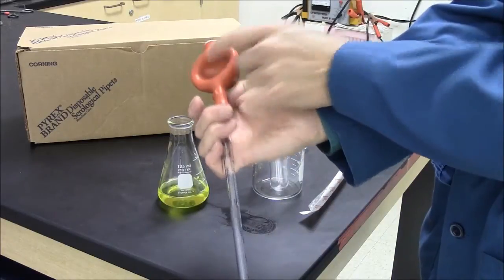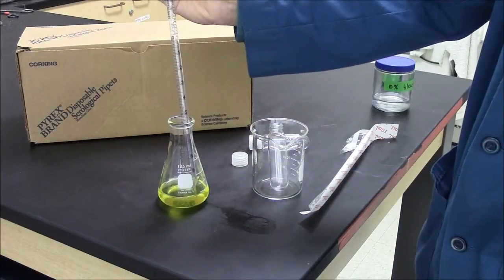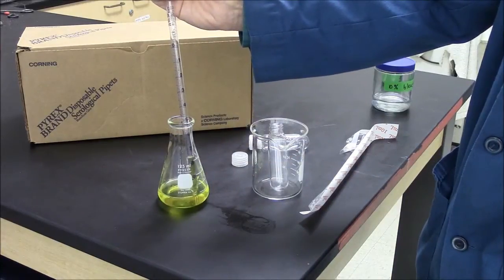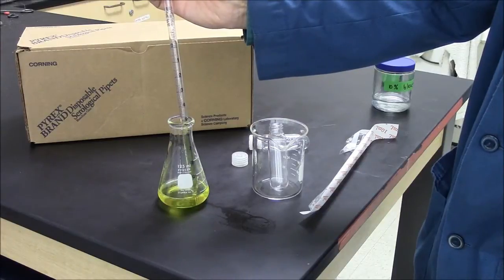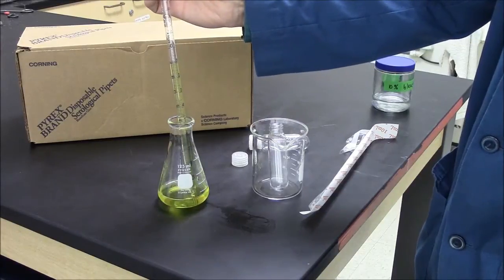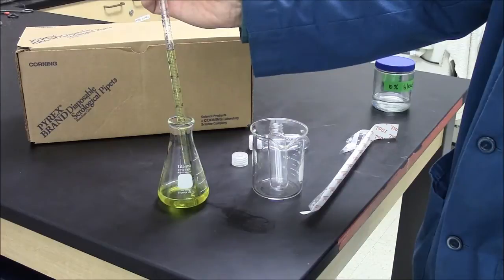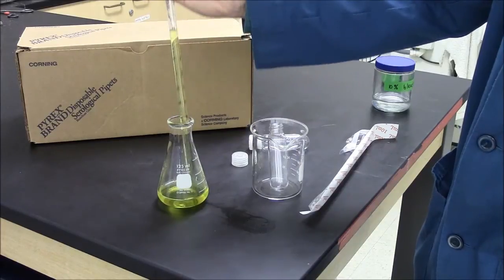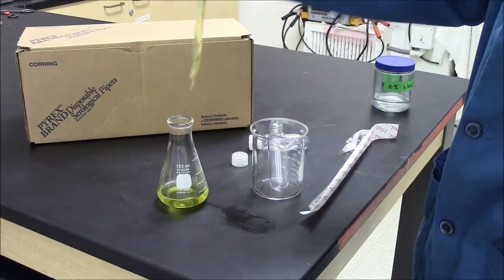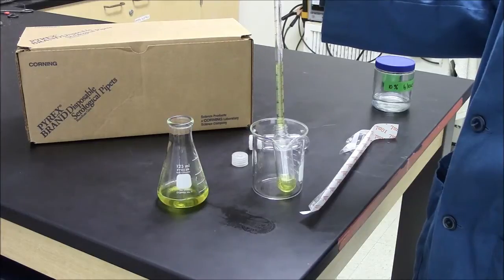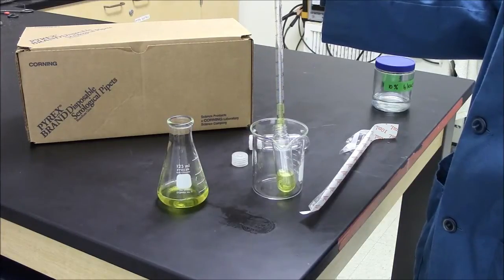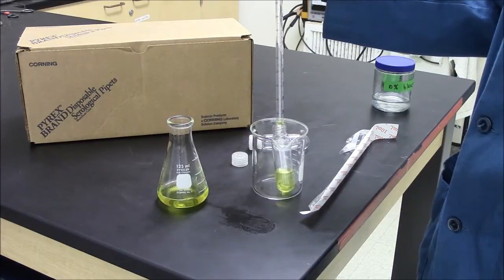I've created a vacuum here. I pull up liquid in the pipette using the up arrow on the pipetter until I get to the zero. That's 10 milliliters. So now I'm delivering using the down arrow on the pipette bulb, delivering my 10 milliliters.